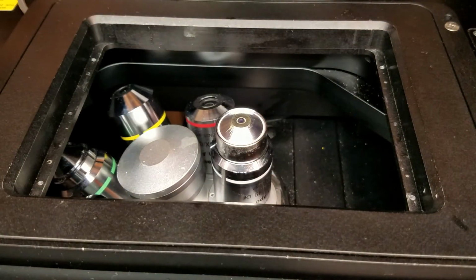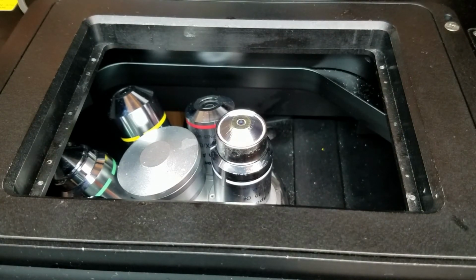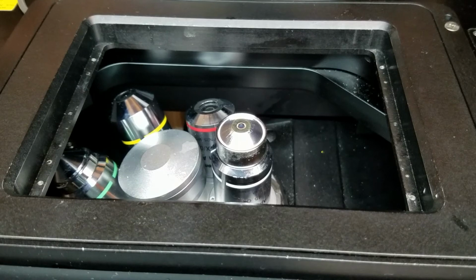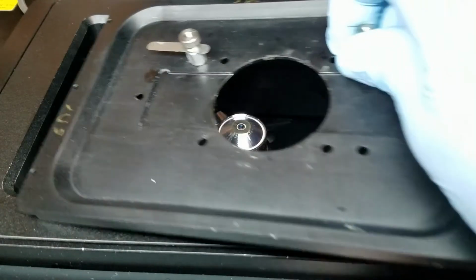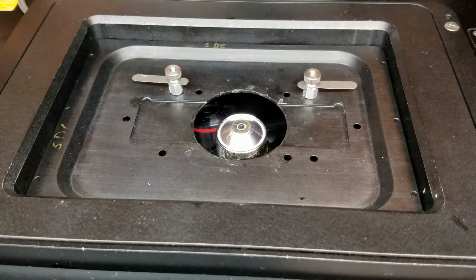All right, and that is everything. Lower the objective back down if you raise it up. Make sure you put the stage insert in place. If you had dropped oil onto the stage insert or have any gunk, make sure you clean that and treat the objectives well. You'll appreciate it when you come in and you get to use a clean objective, and so will the person after you.